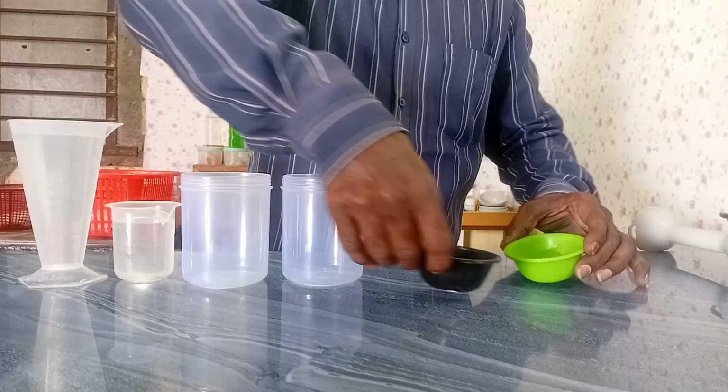So the next question is, instead of converting into gel directly, whether they can use SLES paste in their process. Of course, it is possible with a proper method. First of all, they should not just calculate the active percentage and replace gel with paste. They need to calculate the water content also. First thing. Second thing, in excess amount of water, it is possible to get a homogeneous, more or less clear, transparent medium. Let us check it practically.